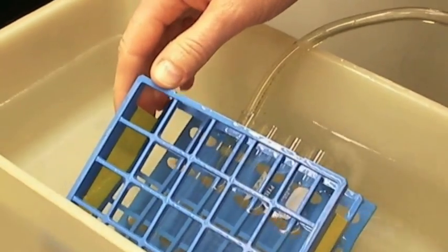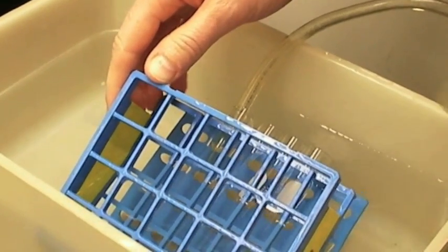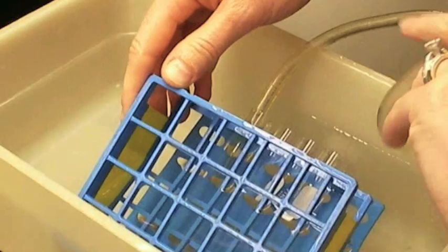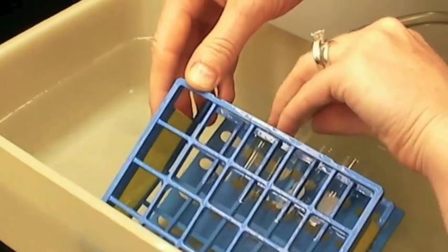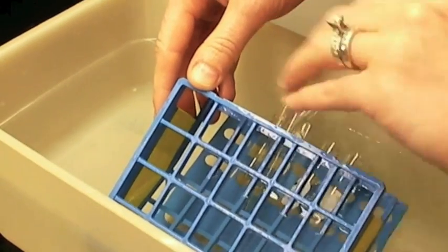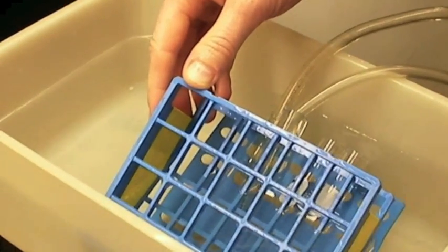Now, you might need one or two hands to do this, but you want to make sure that your test tubes are already in their holder before you go ahead and do this.